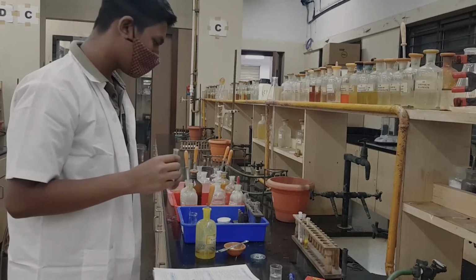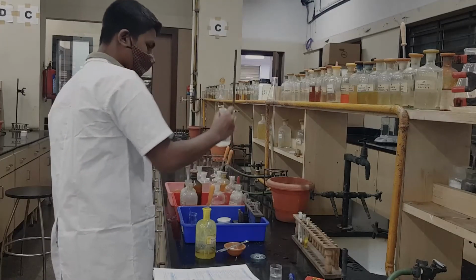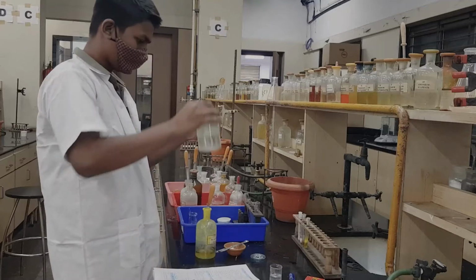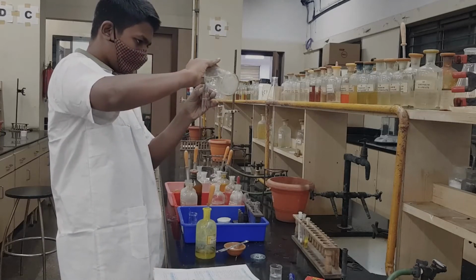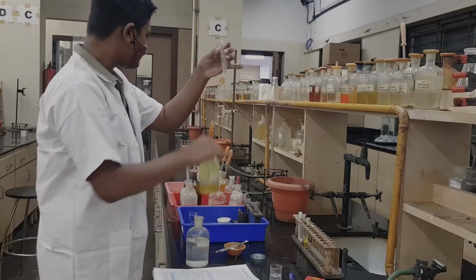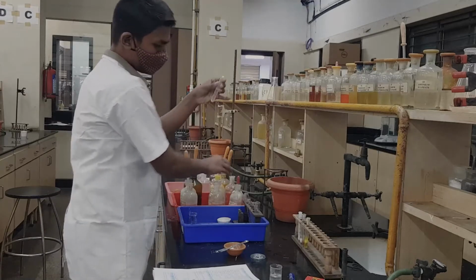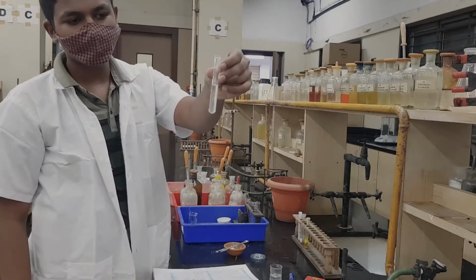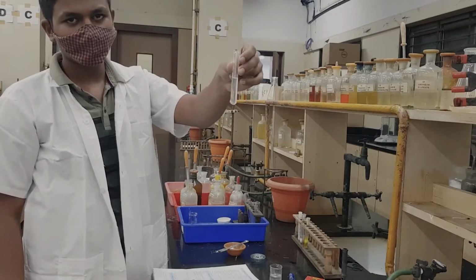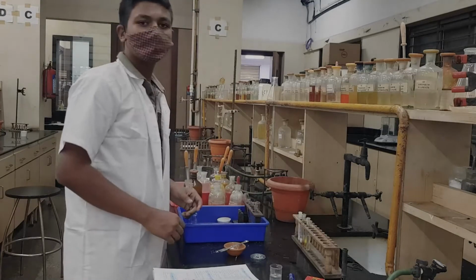To the same solution we continue to the second test. You can add H2S water to it. OS plus dilute HCl gave no PPT, so you continue with the same solution to the next test. You added H2S, the expected result was a black PPT, and you can see there is no black PPT; the solution is very clear. So, group 2 is absent. Your group 1 is absent, your group 2 is absent.